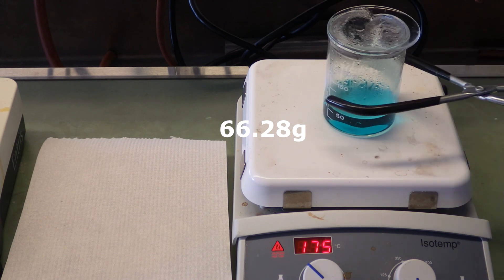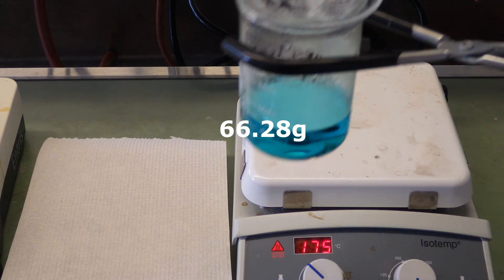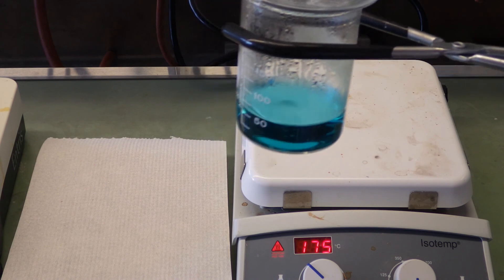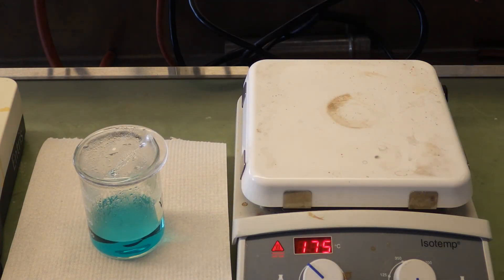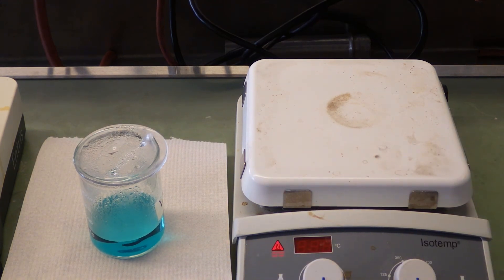Looks like the solids have all dissolved. I can tell that because the solution is clear. If there were some insoluble impurities, the filtration would pick it up in any case. Now we want to let that cool slowly at this point.